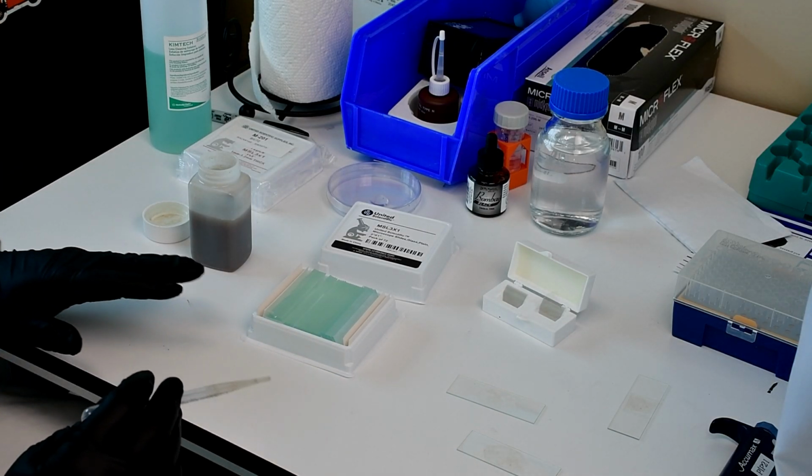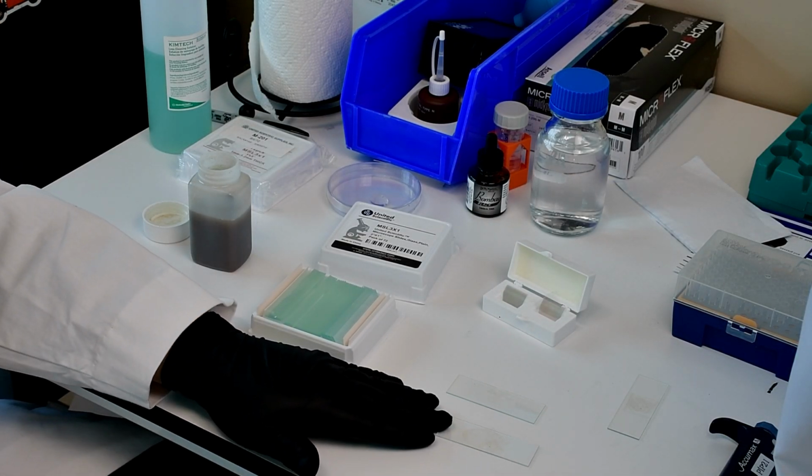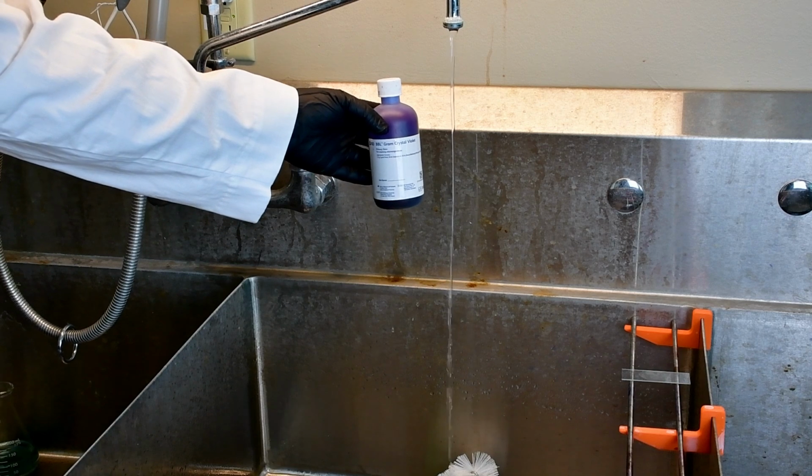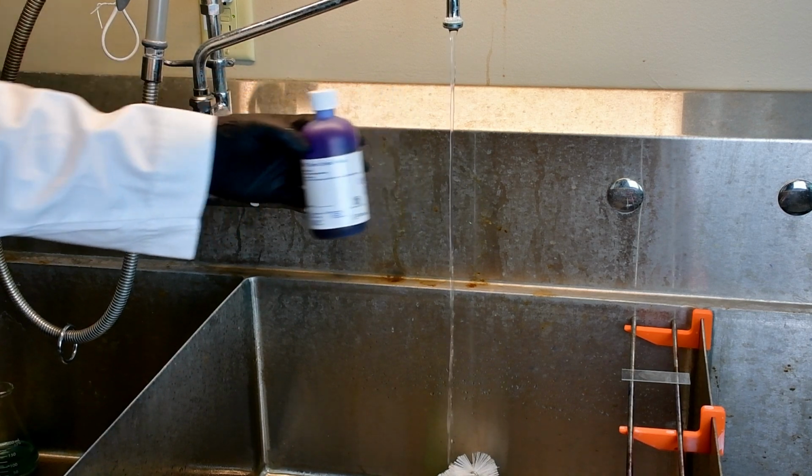And now, once that's done, I'm going to let these air dry, and then we're going to stain these. So the first stain we're going to go through is called a gram stain. It's going to involve two different staining colors, an iodine, and a decolorization step. Now, the first step we're going to do is applying gram crystal violet to the dried slide.